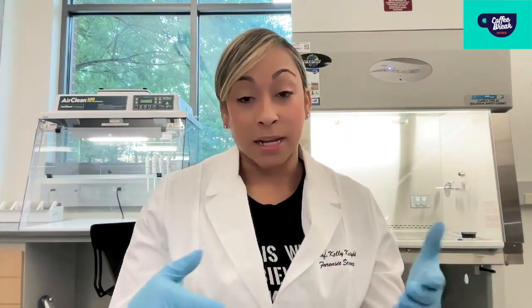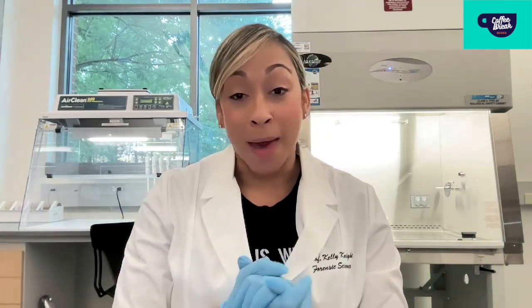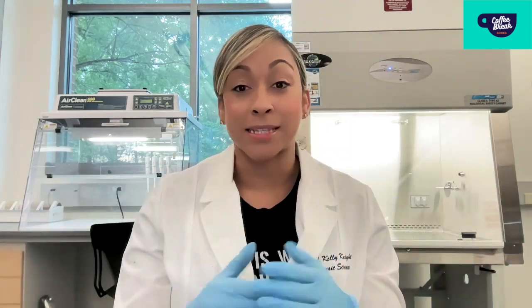The first step, of course, begins with the crime scene. You want your students to first properly collect and package their forensic DNA evidence, meaning it needs to be in paper packaging and needs to be properly sealed. You can start either with the mock crime scene, or you can actually just hand them their DNA evidence already pre-packaged. There are two different types of tests that I like to do as a follow-up to DNA evidence collection.